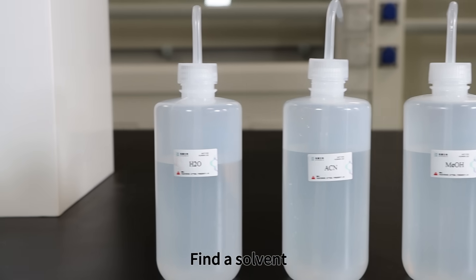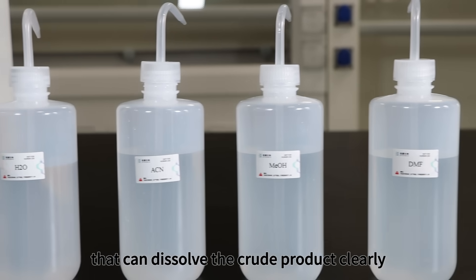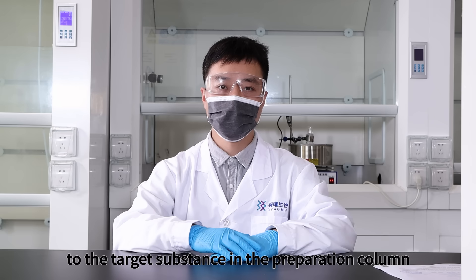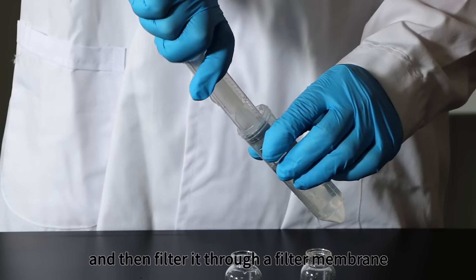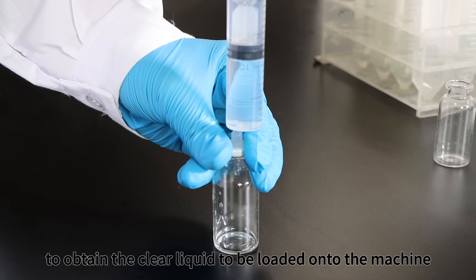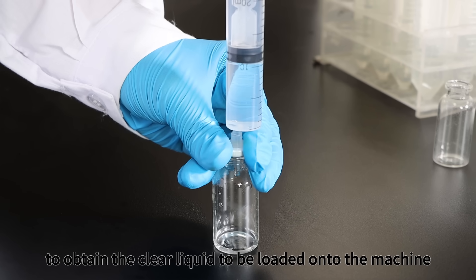Step 4: Pre-treatment of crude peptides. Find a solvent that can dissolve the crude product clearly, without causing damage or destruction to the target substance in the preparation column. Then filter it through a filter membrane with a pore size of 0.45 microns to obtain the clear liquid to be loaded onto the machine.